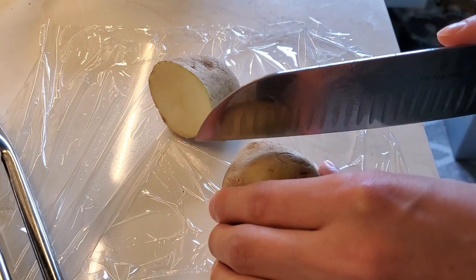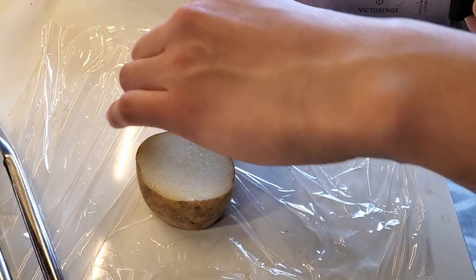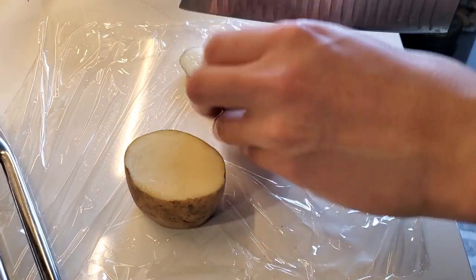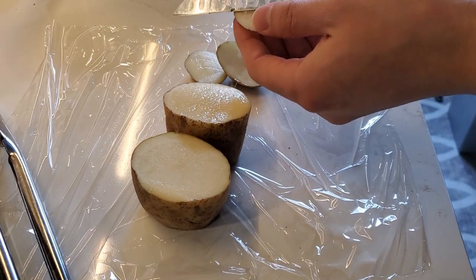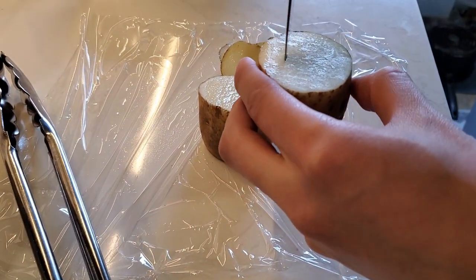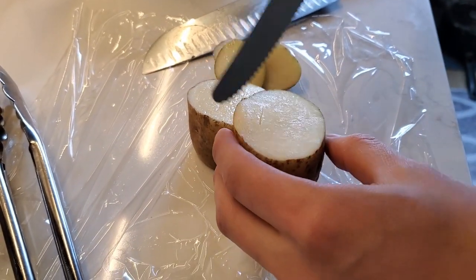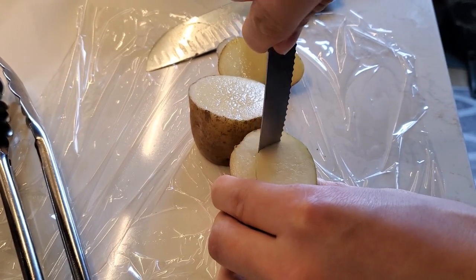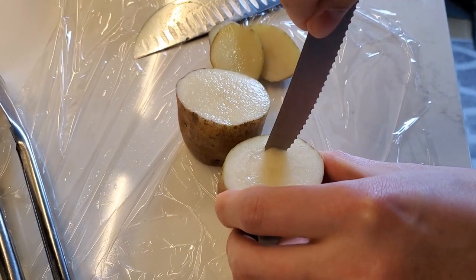I'm going to go ahead and chop this potato like this, and then chop this potato like this. Okay, so they're about the same sizes. Also I'm going to go ahead and dig a little hole inside of this potato - let me use a different knife - dig a little hole in the potato. This is so that we can see the diffusion.